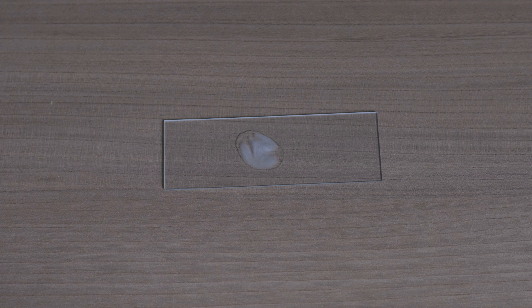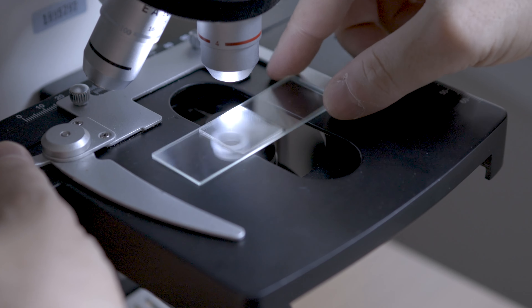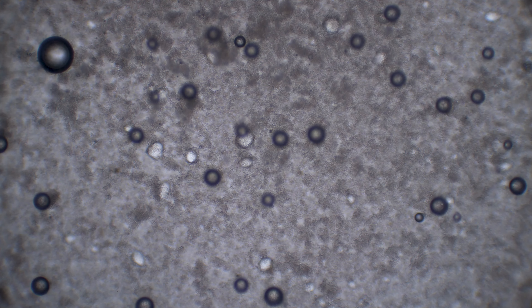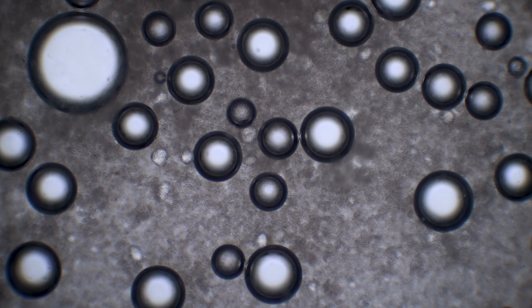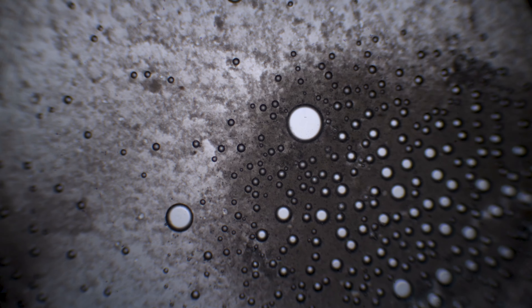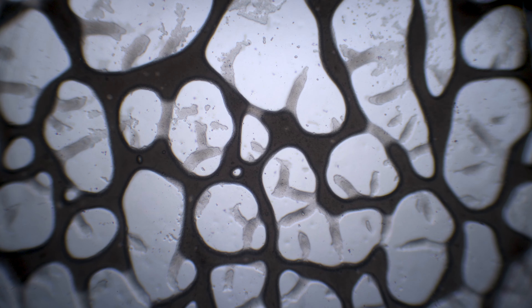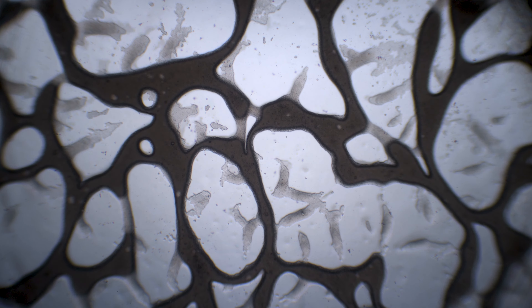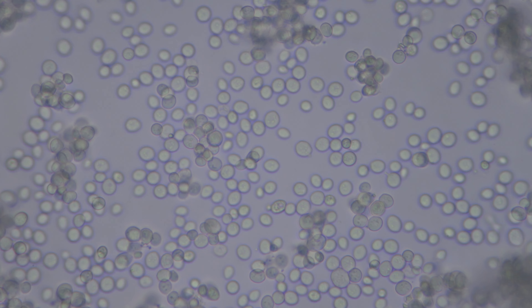Let's look at this process under the microscope. All this process is done by this tiny fungus. We simply call it yeast.